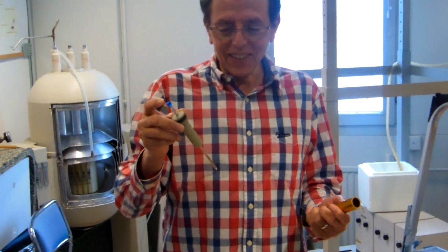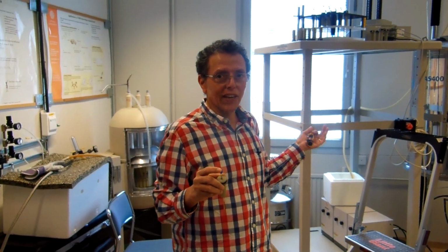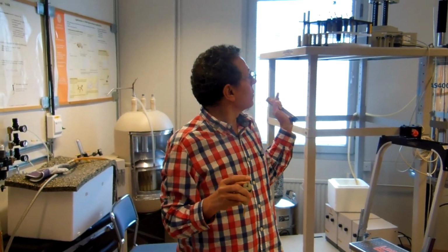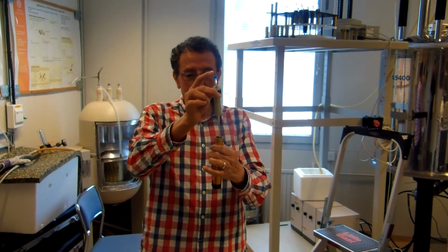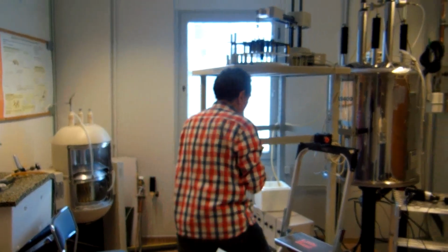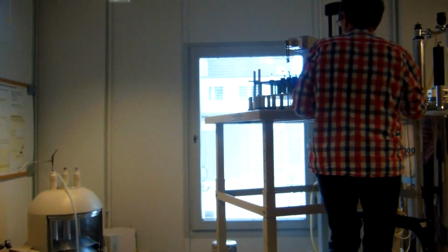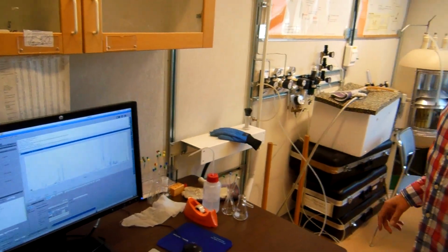Hello again, everybody. Now I'm going to show you the NMR of the other machine, and the idea is to see how the machine takes our sample. So mashallah, we have very good infrastructure. This is the sample, as I told you before, and now I measure it. Then I go to fix it in the machine, so I put it in number 2. Of course, when you come here to the NMR, you shouldn't have any metals, like cards, phones, etc.